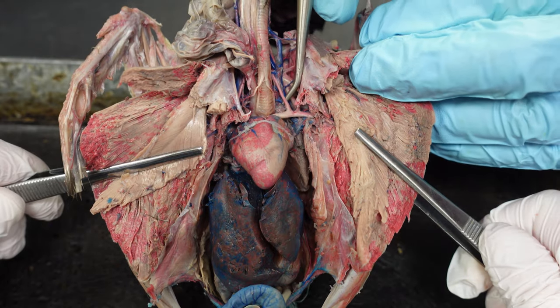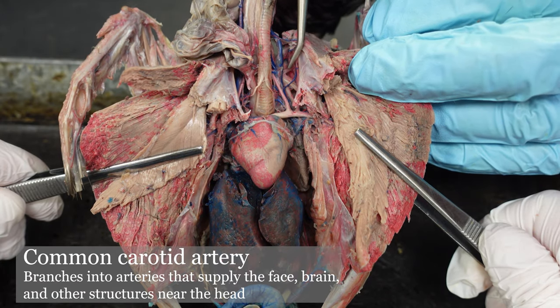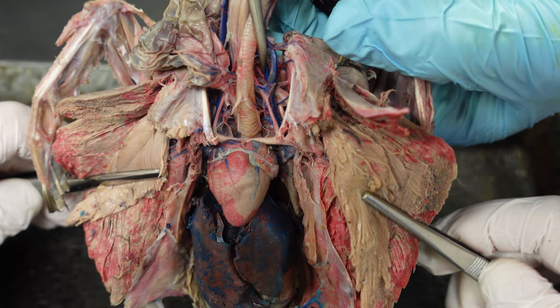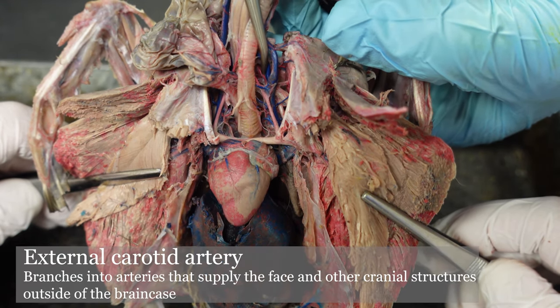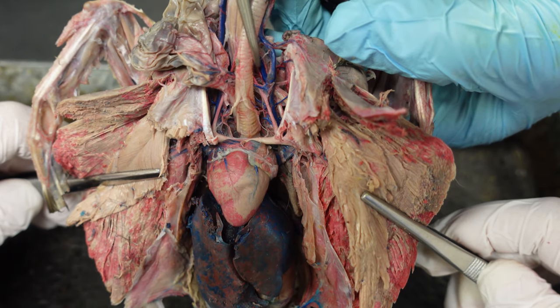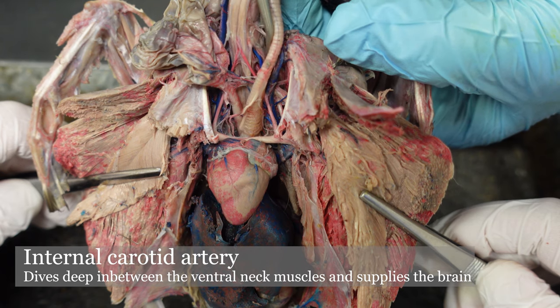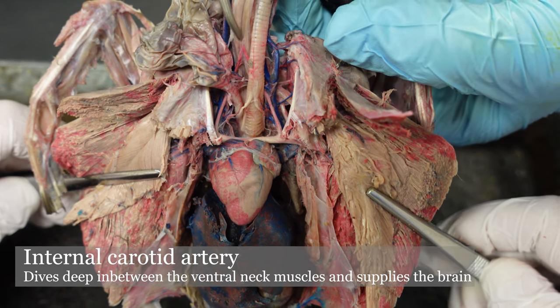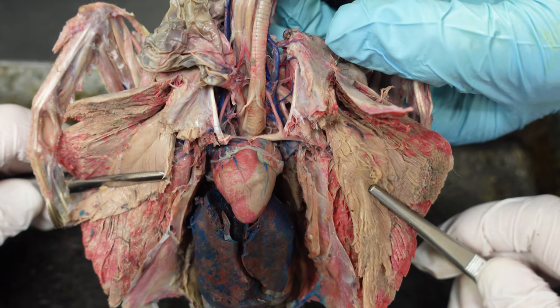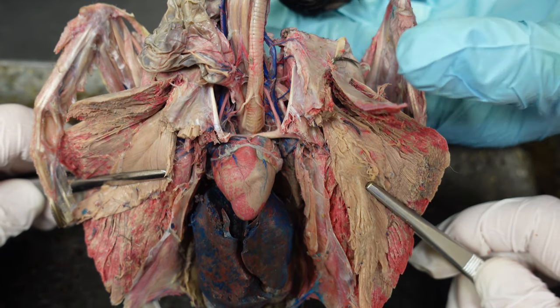The one going toward the head is the common carotid artery. Coming off of that common carotid artery, we have two branches: the external carotid artery, which is diving down toward the dorsal side of that neck, and the internal carotid artery, which goes down in between these muscles and travels up the neck toward the brain. Those are the only ones you need to know as far as the arteries on the neck.